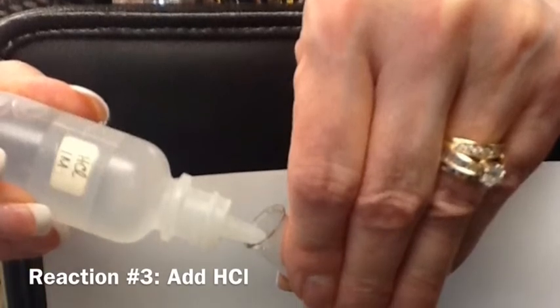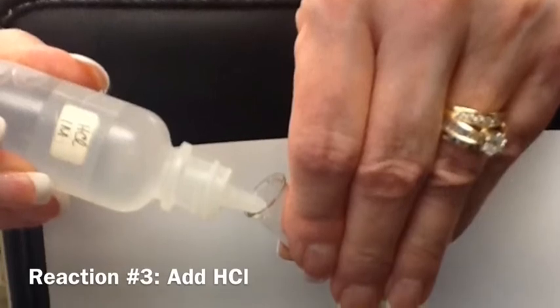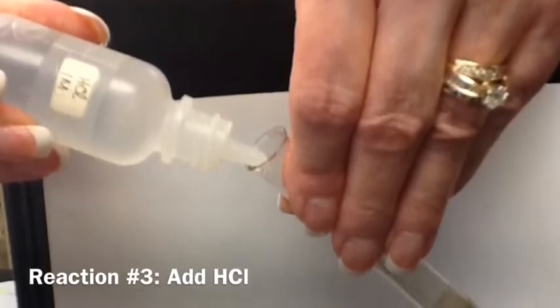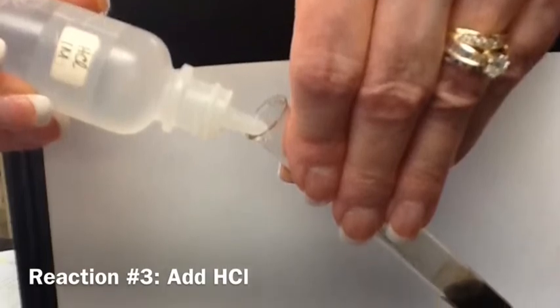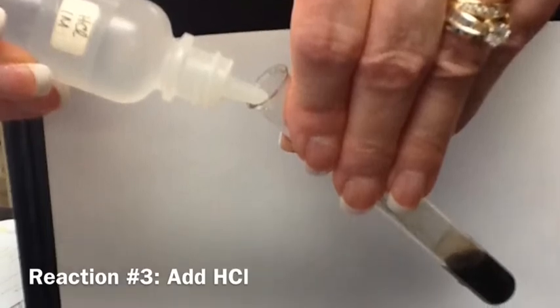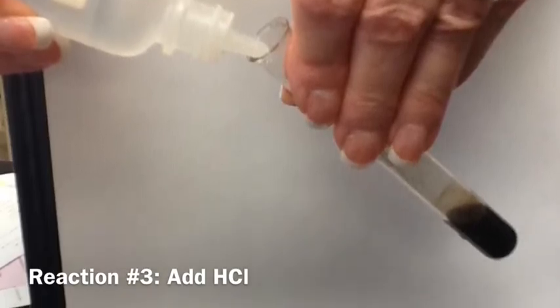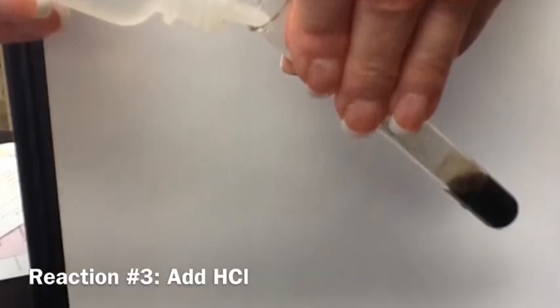In reaction number 3, you're adding hydrochloric acid, and you will see a dramatic color change. Make sure that all of the black color disappears, and if you had to add extra sodium hydroxide in reaction number 2, you will have to add a little bit more hydrochloric acid than the directions call for. Make sure that you stir it carefully or tap it between your fingers to mix it, and then be patient. Sometimes it takes a moment for this reaction to completely occur.